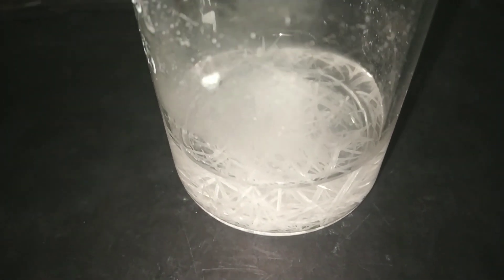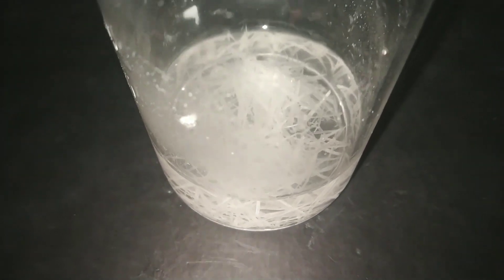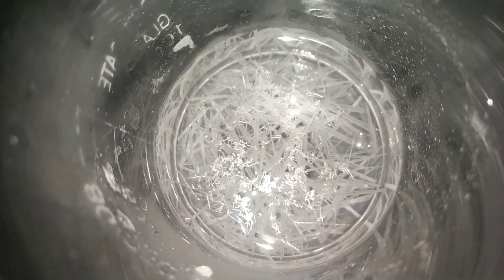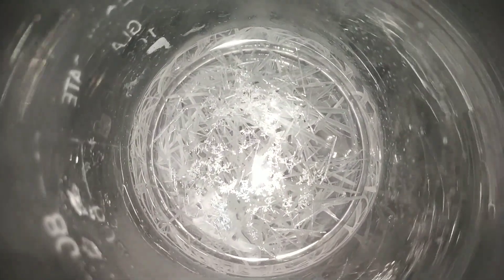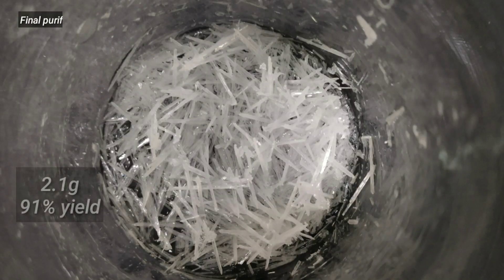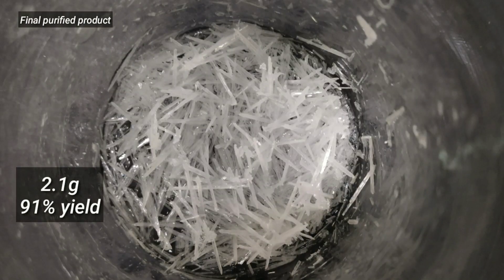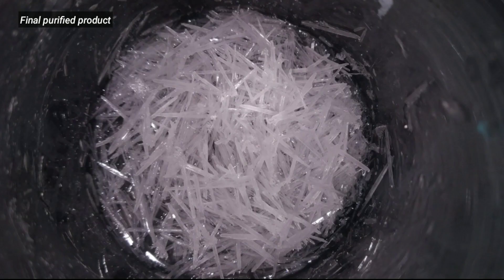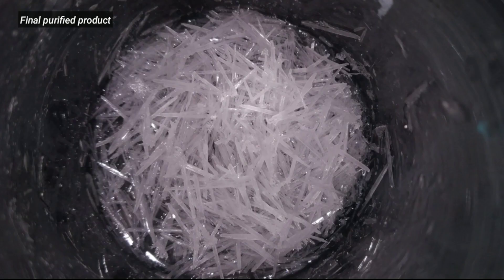After 2 to 3 hours, you can see the needle-shaped crystals of Hippuric Acid have separated out. Now we decant the supernatant solution and dry the crystals which have separated out. And this is the final pure product — the Hippuric Acid.